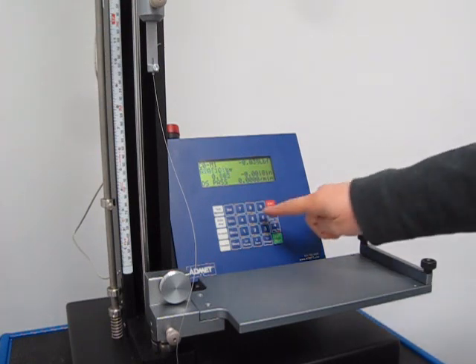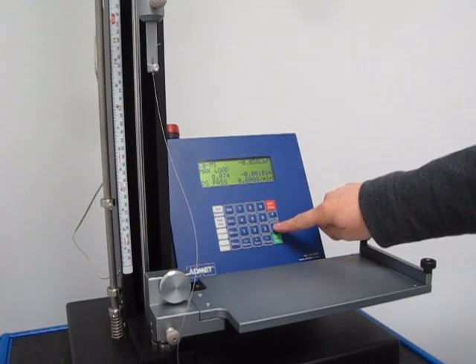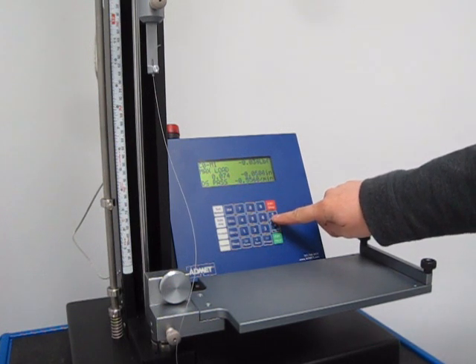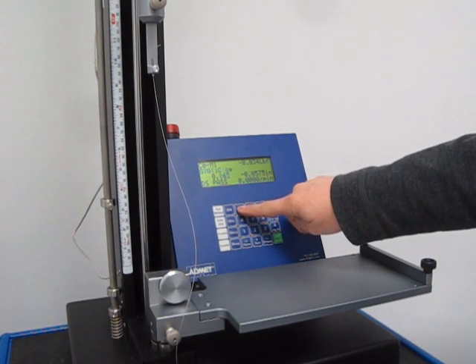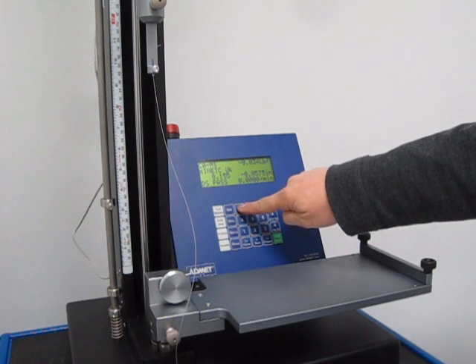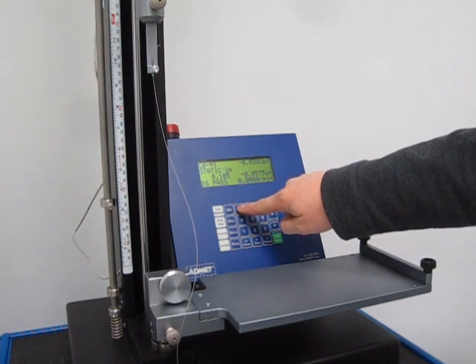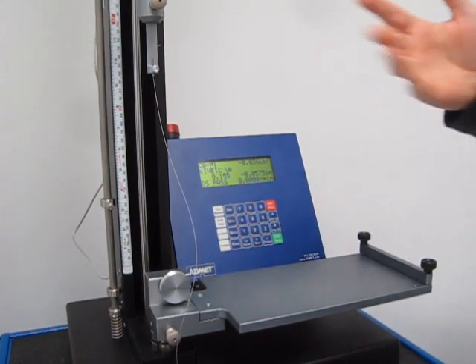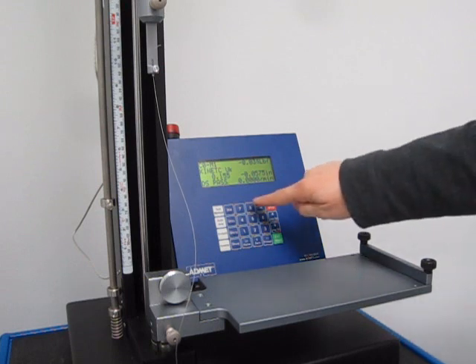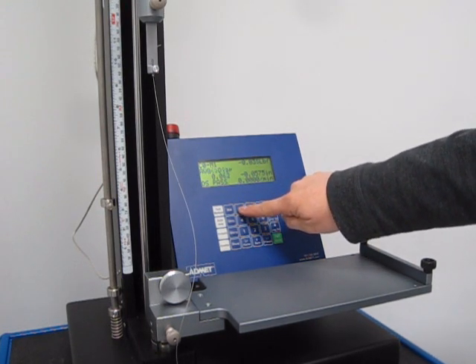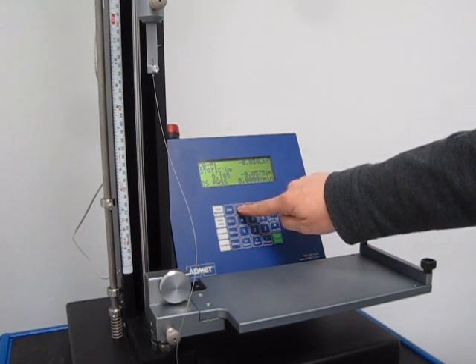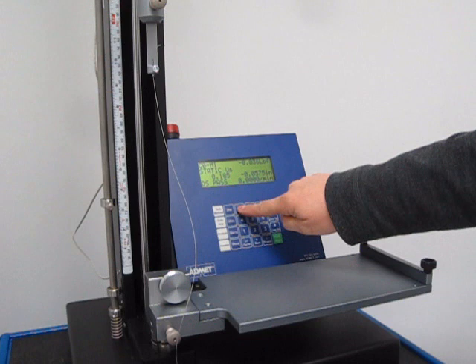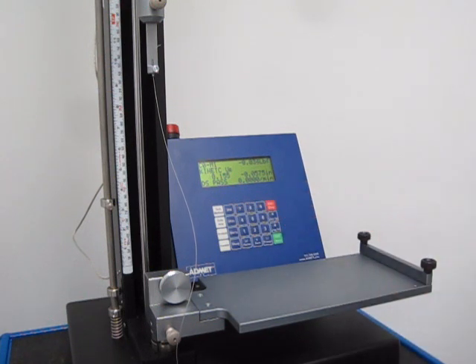That's the way it works. You can press seven to toggle between each of those, otherwise it just rotates for you. You have max average, then the static 0.185, and then the kinetic 0.155. Thank you.